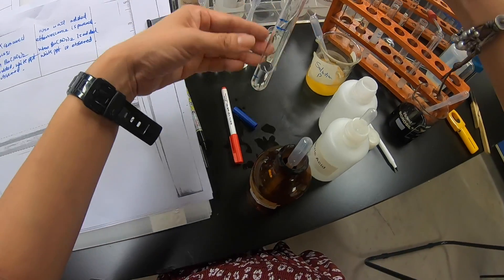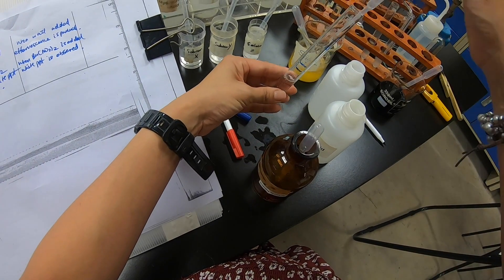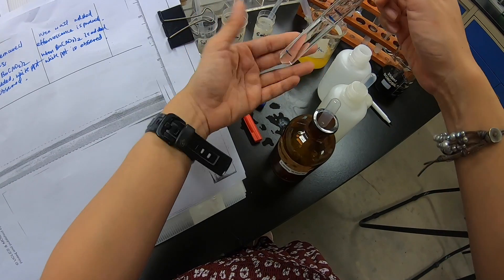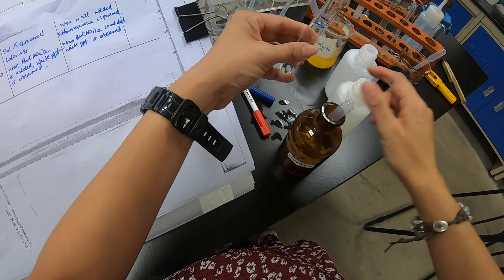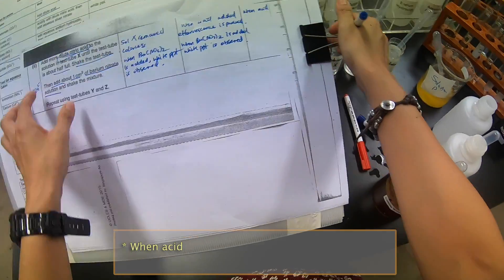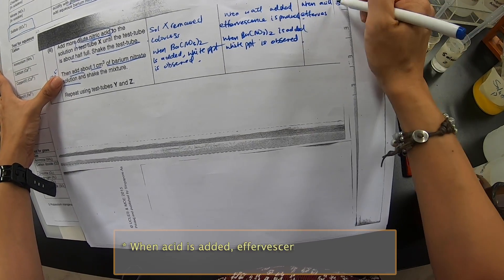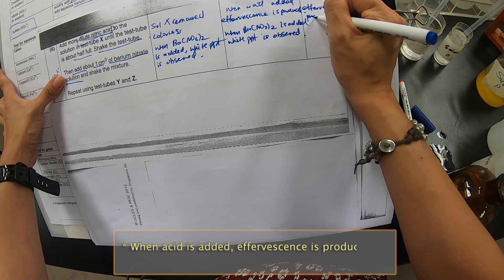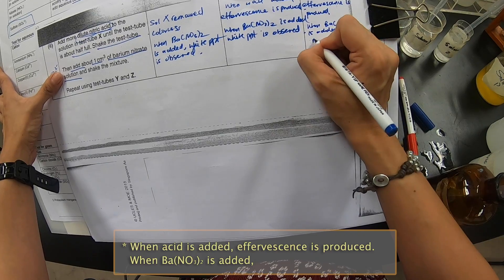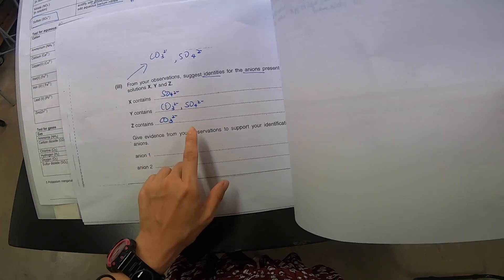Lastly, Z — add more acid. Effervescence is observed, but it's still a clear solution. Add barium nitrate — no visible reaction. When acid is added, effervescence is produced. When Ba(NO3)2 is added, no visible reaction. Since there is no sulfate here, I will not write SO4 for Z.